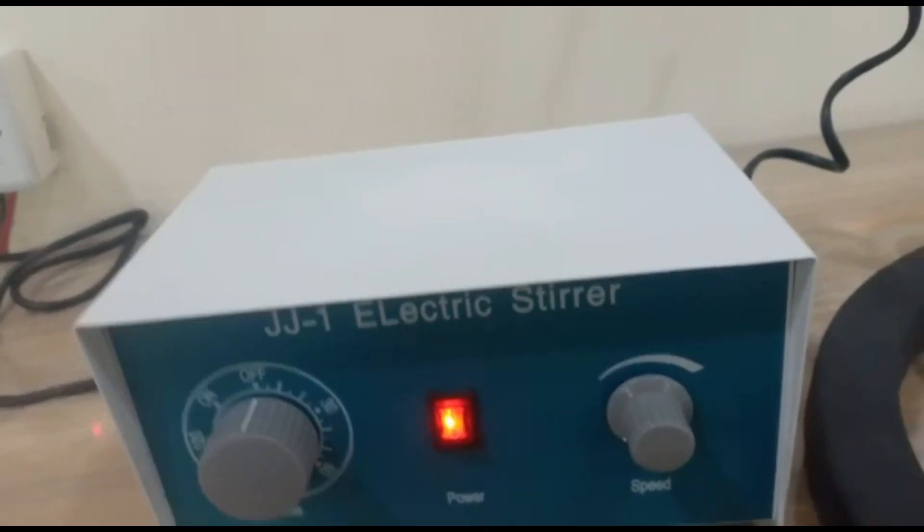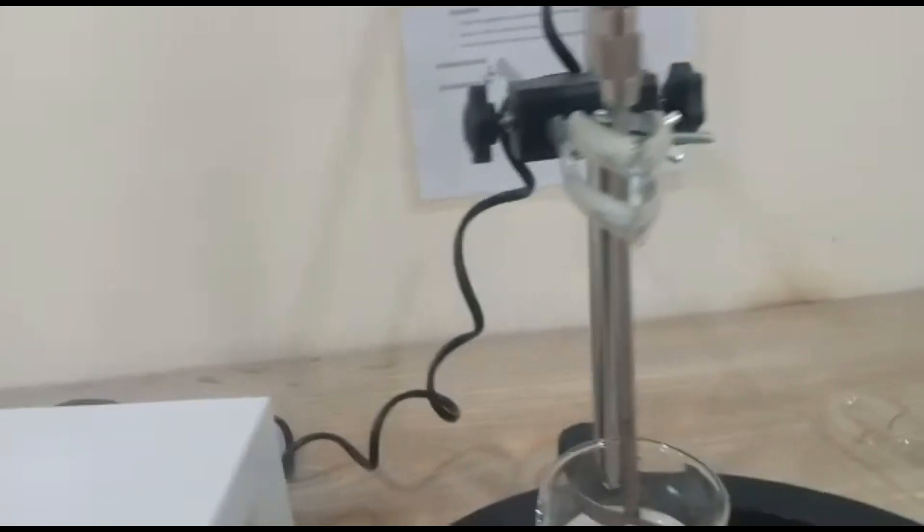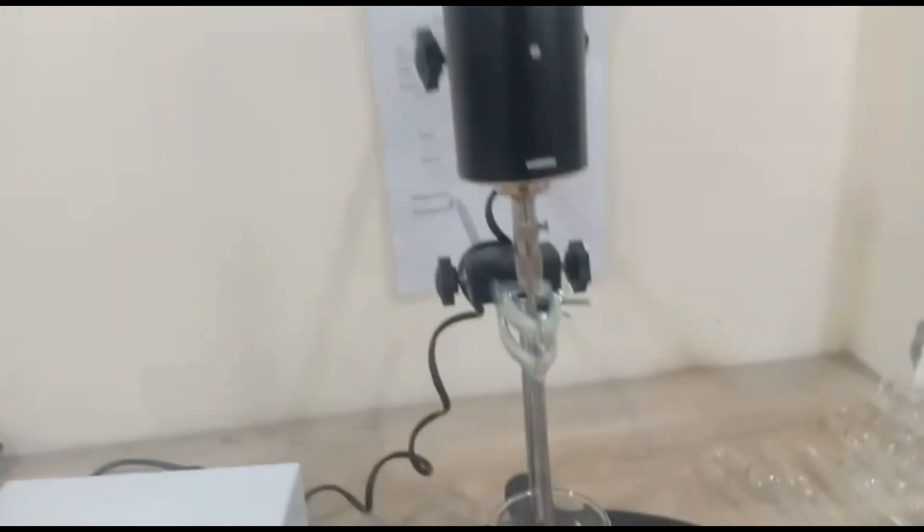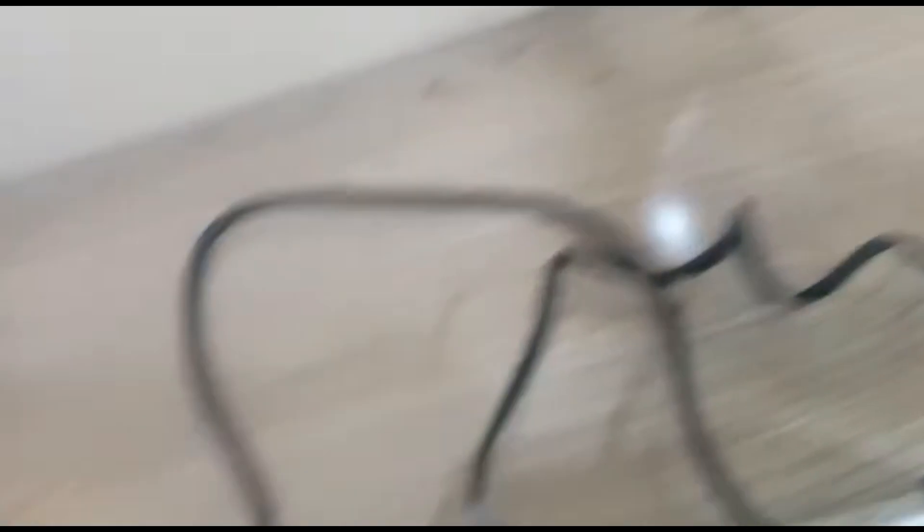But before we turn it on, we have to assemble this instrument with it. We do it with the wire and assemble it on the back side.